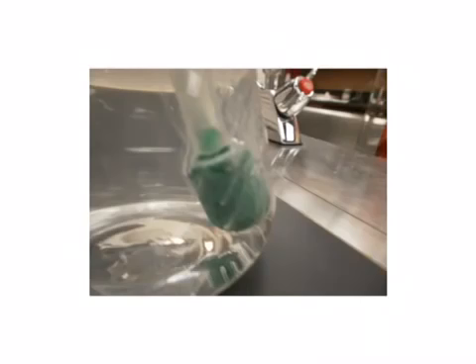So here you can see a close-up of the aerating stone in action. It is porous, and when air or gas is forced through it, it escapes this stone in tiny little bubbles. The smaller the size of the bubbles, the greater the surface area between the gas and the liquid, which is where the reaction occurs.